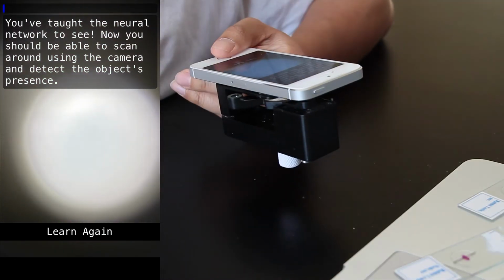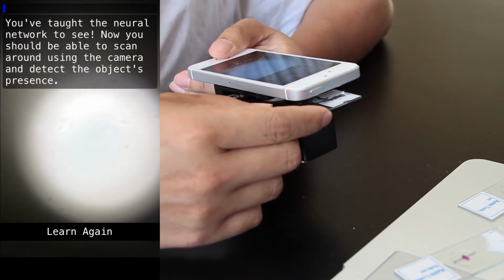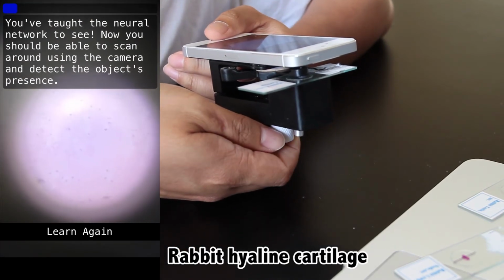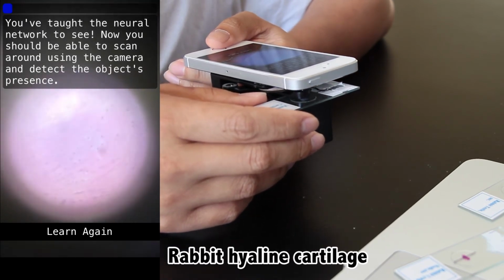And now we're going to start doing something really interesting. We're going to start showing it new types of tissues that weren't in the training set that it's never seen before. And what we're wondering is if it faces any kind of issues with false positives. So we're trying a bunch of different tissues that look similar, and we're going to try to see if we can trick it into recognizing this as what we showed it before, which was liver tissue.